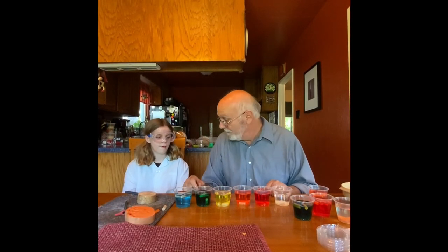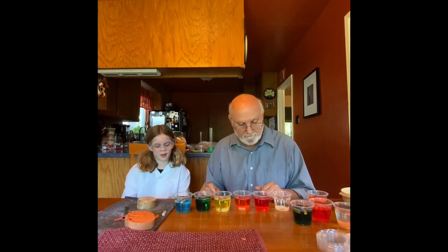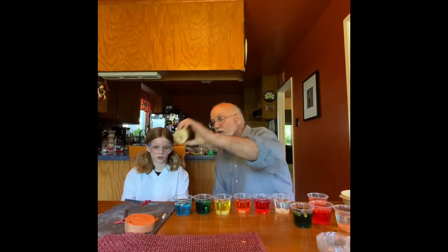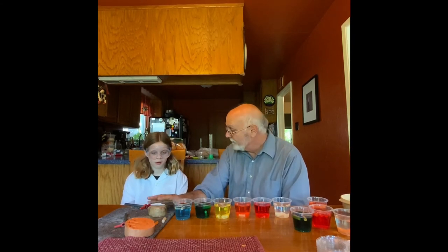You can tell by whether it floats or sinks — the more solute you have affects whether it sinks or floats. What we find out is it's the amount of sugars, basically the starch inside — starch is just a complex sugar called a polysaccharide because it's a whole bunch of sugars together. That's a big word! And that's the sort of stuff we eat from potatoes, bread, or things like that.